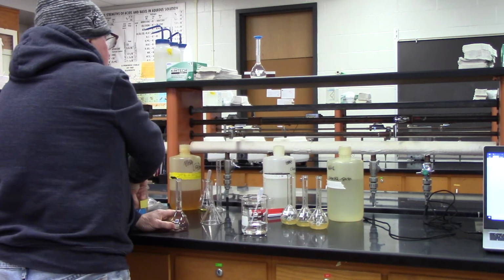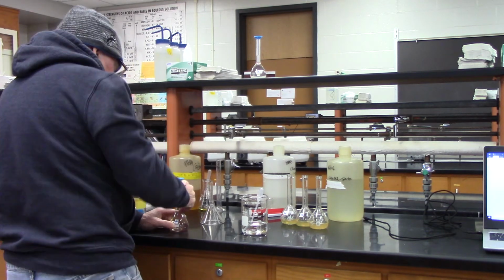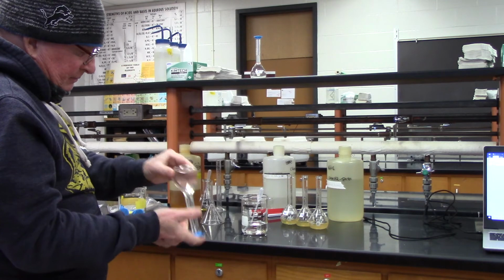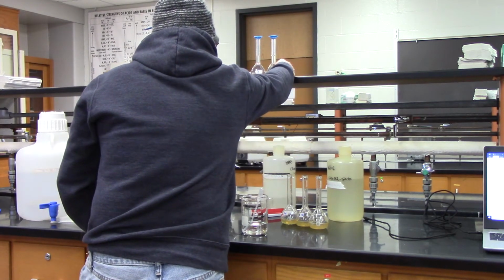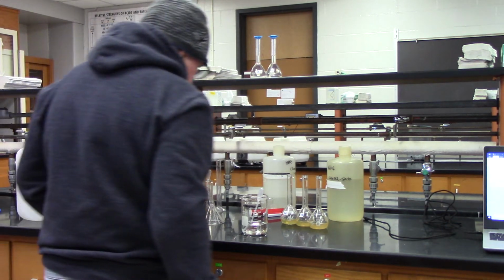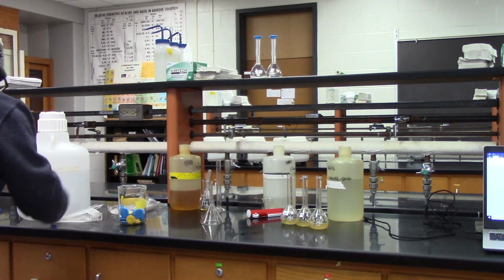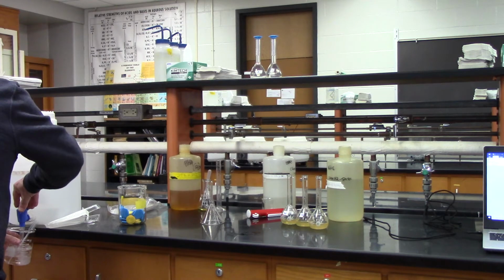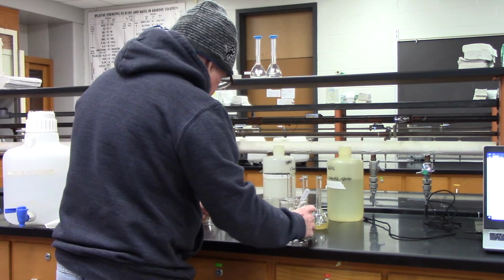Right, number two. Okay, when I look at number one, number two looks a little bit more cloudy. Okay, I'm going to add more of my nitric acid to my beaker.